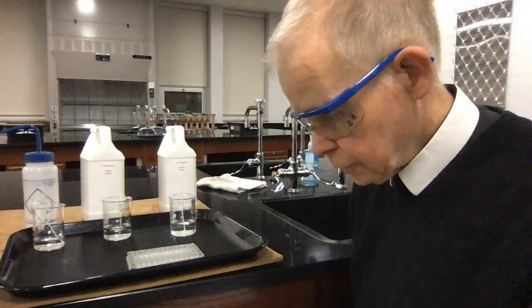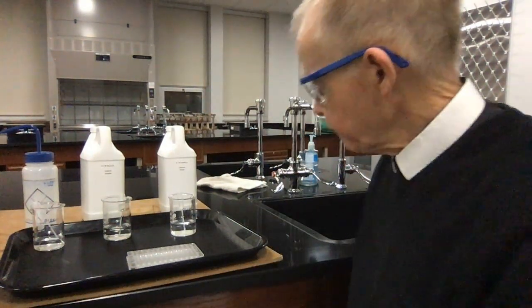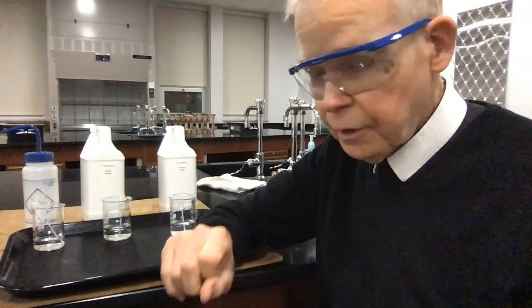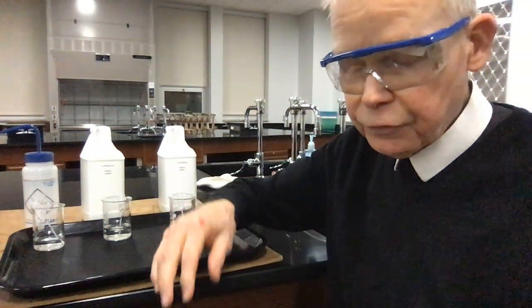So let's take a look at the procedural step. This is again using the well plate, and I've put all the reagents in here already that we need, with the exception of that calcium nitrate in the top left well. And then I'll show you how we do the series of dilutions. Once we've done all that, we're going to mix the cells of B with those of A, and when we do that, it'll form, we hope, a precipitate, and then we're going to analyze that precipitate.